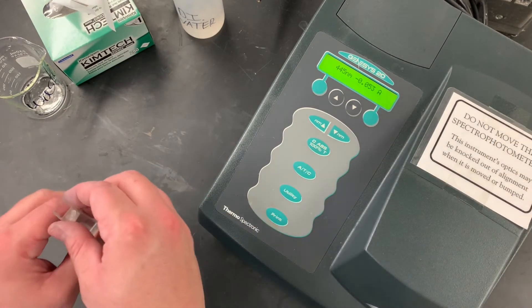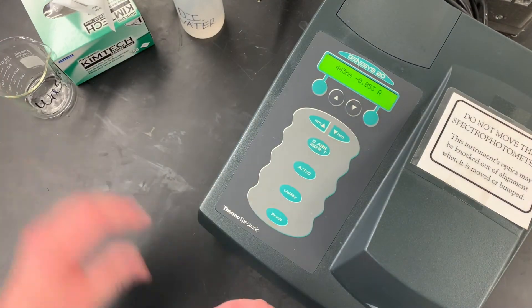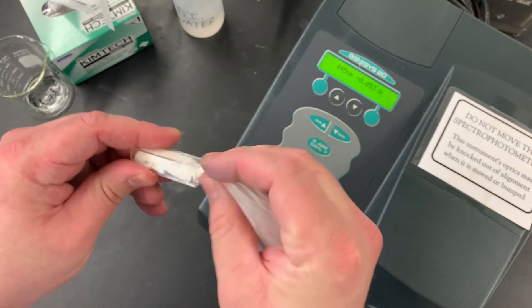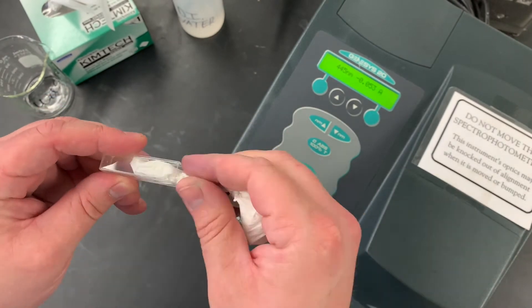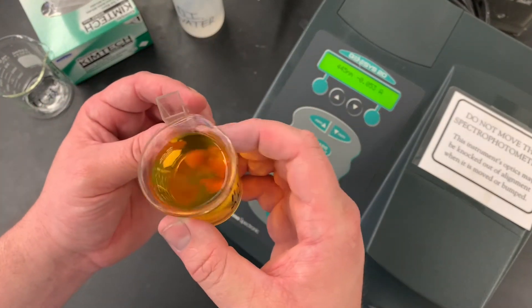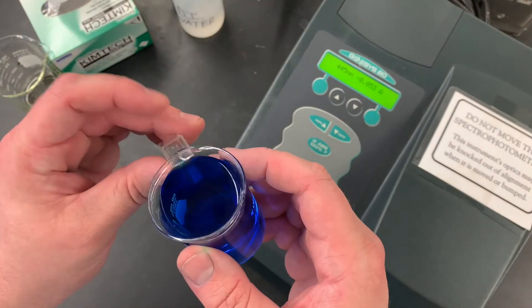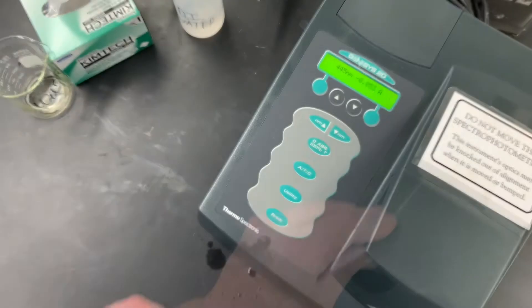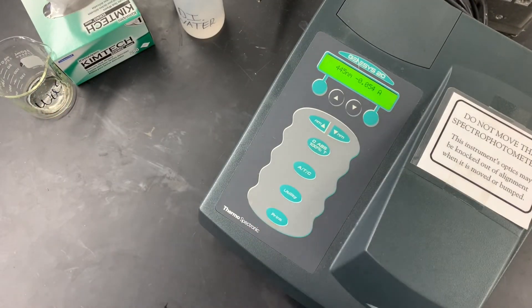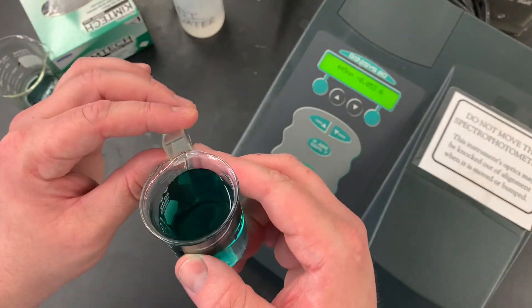Pull out the waste container. Make sure the cuvette is nice and dry. We're going to start off here with the HCl. So you're going to test each one — wash out the cuvette, dry it, fill it, test, repeat, until you've gone through the entire set of solutions.